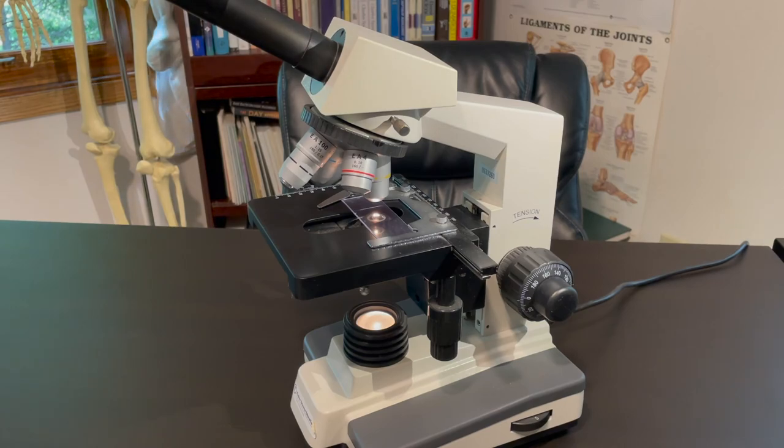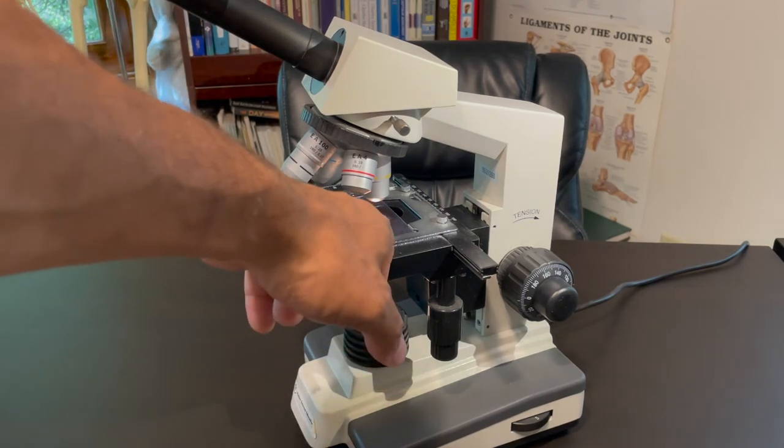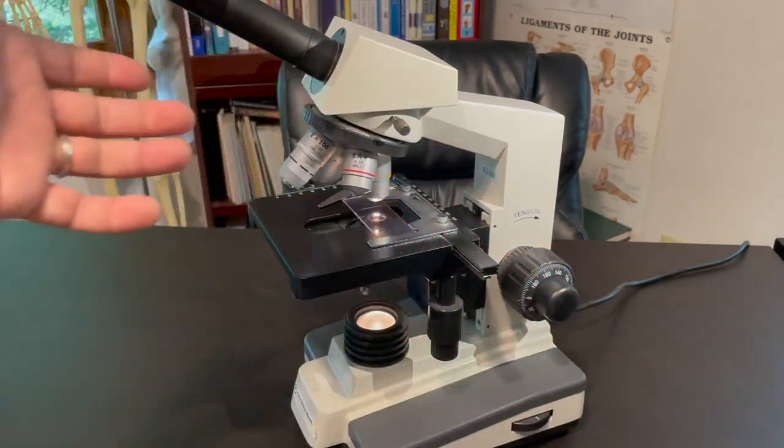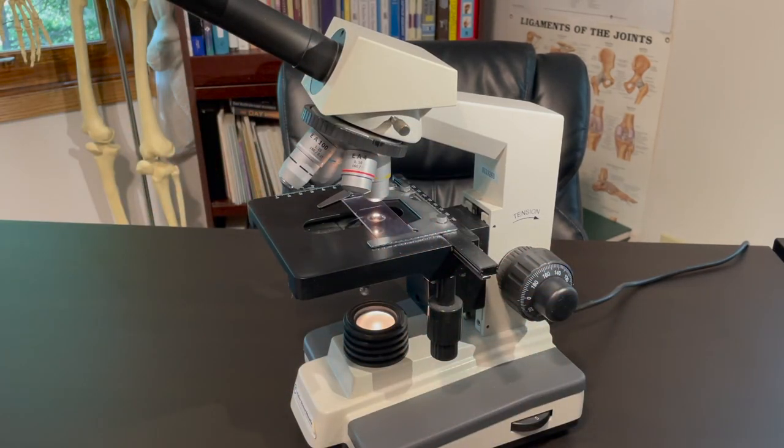So that's all the parts of the microscope, how you get set up and how you focus and how you move your specimen around. Thank you very much and enjoy.